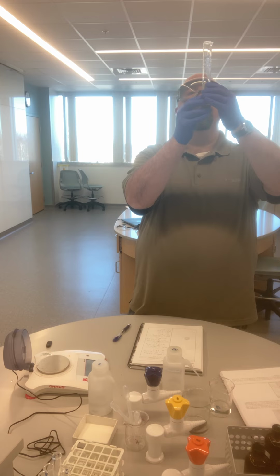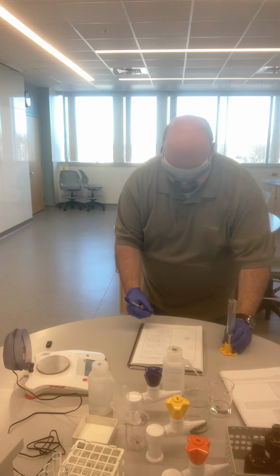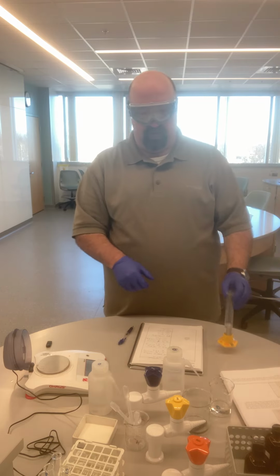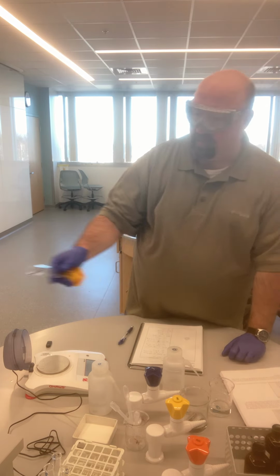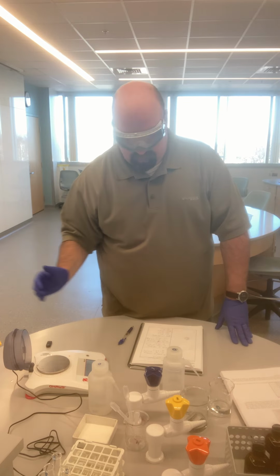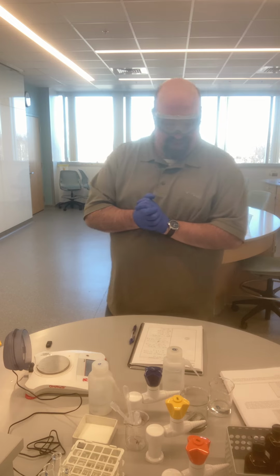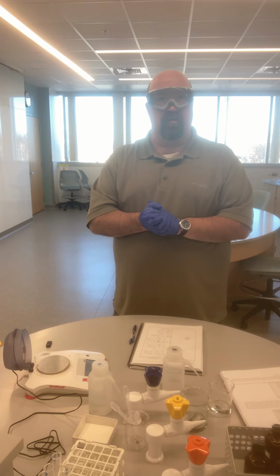Drop the metal down in. Looks like I had just enough in there. For a final volume now of 20.0 milliliters. And so again, the difference between those volumes would be the actual volume of the cylinder. And so that should be all the data that you need in order to find the densities of the 3 different liquid unknowns and the 2 different metal unknowns.